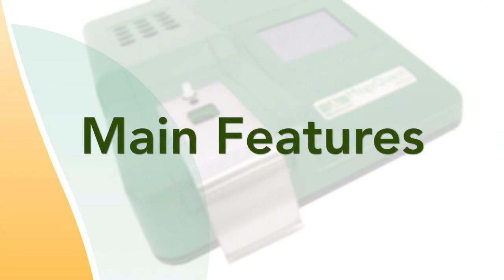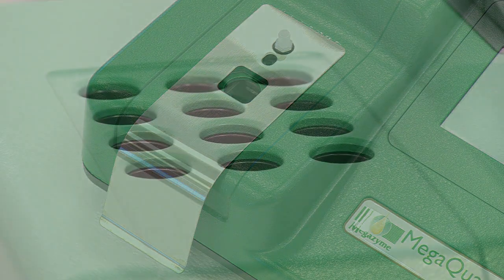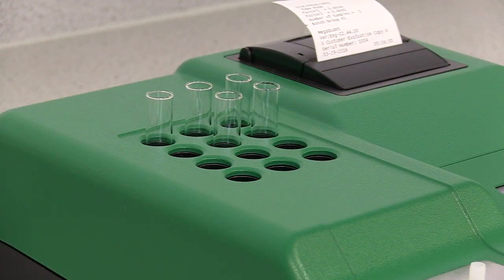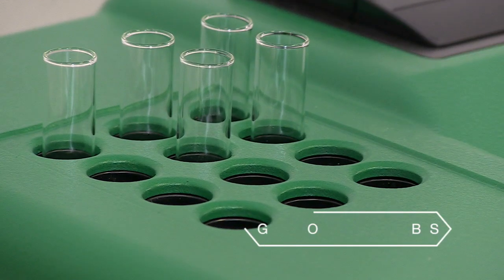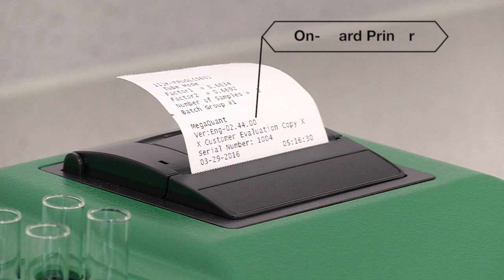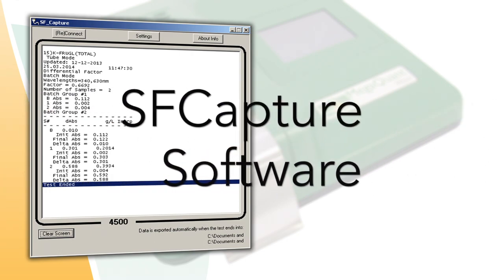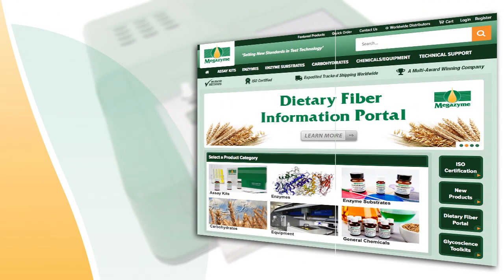Some of the main features of the MegaQuant Wave include a temperature-controlled read cell and a 12-cell incubation block that are both able to be set by the user to ambient temperature or 37 degrees Celsius. The read cell and incubation block accommodate standard glass or plastic 12mm tubes in which the Megazyme kit assays are performed. There is an onboard printer for output of results. Alternatively, results can be electronically exported via the SFCapture software through connection to a computer. The software is available to download along with instructions from the Megazyme website.